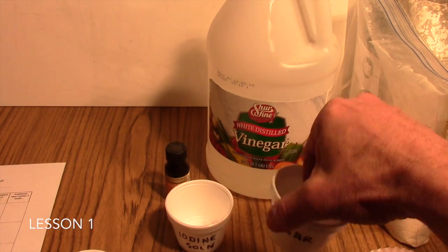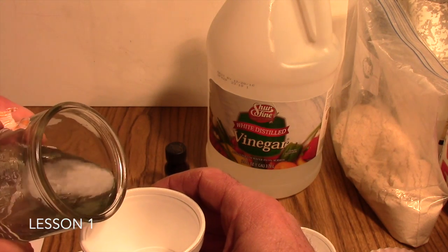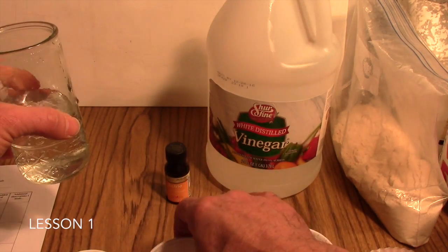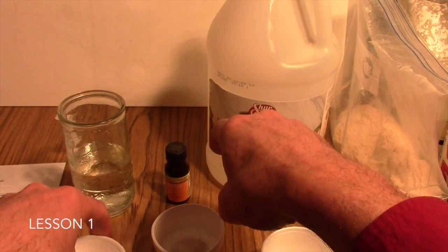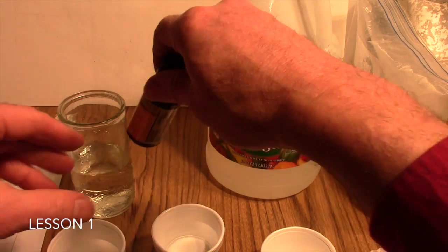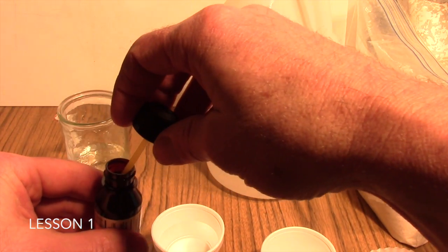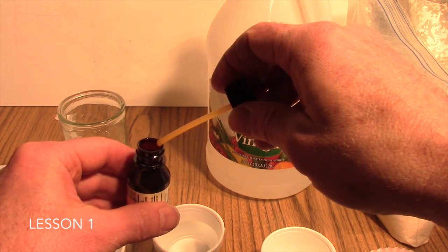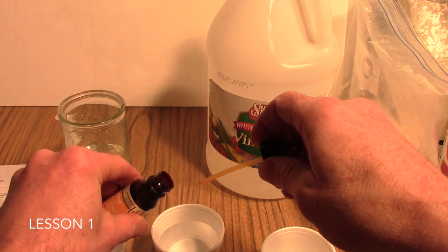Okay, the vinegar we would fill. I want to show you what the iodine solution should look like. We're just going to put some water here. Your goal is to make a test solution of iodine that just resembles iced tea, just a light brown color. Now, one thing you'll want to do is caution your students that iodine does stain. It stains fingers, it stains clothes, and it is poisonous.